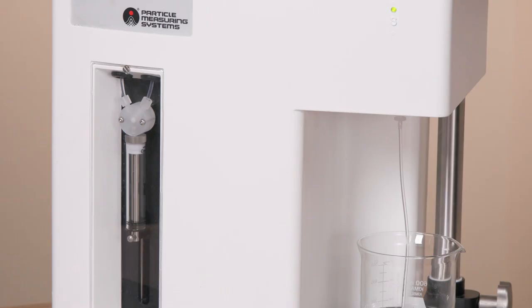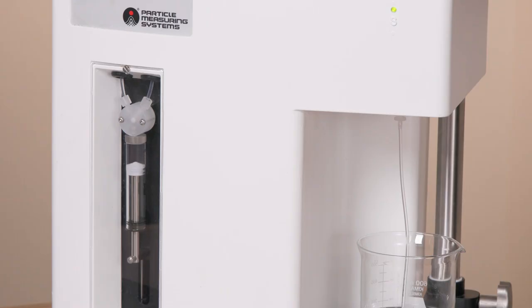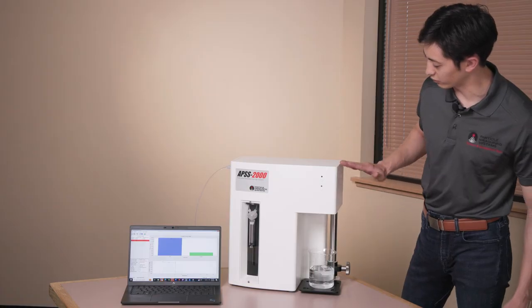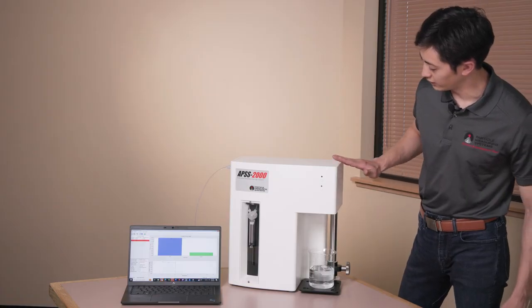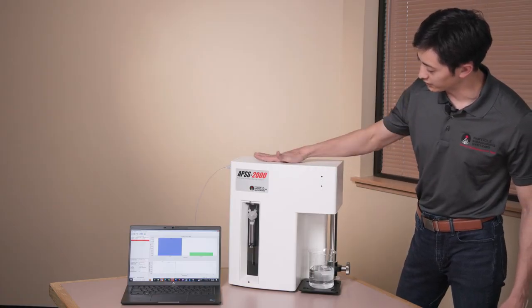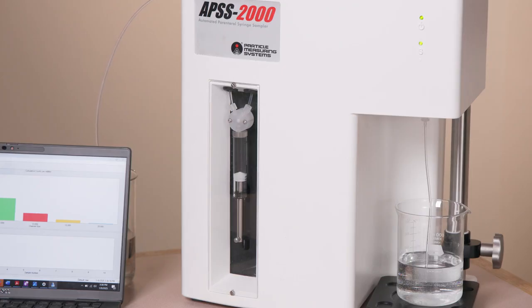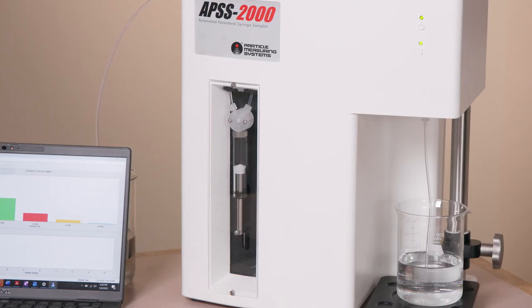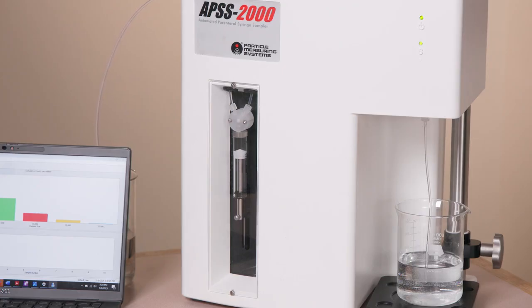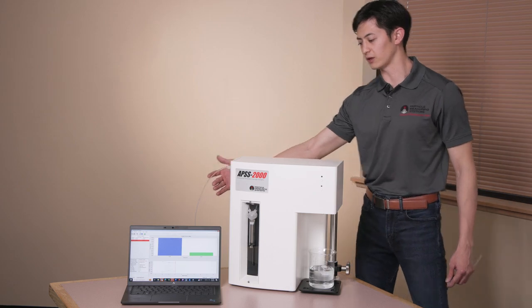When the instrument is sampling, the syringe actuates. Fluid is drawn through the inlet and taken through the sensor, which sits in the top of the unit here. When the syringe pushes back up, it ejects the spent sample out of the side of the unit here.